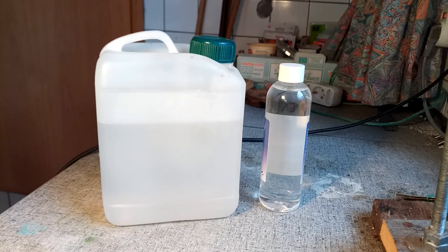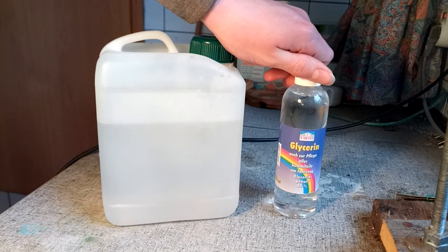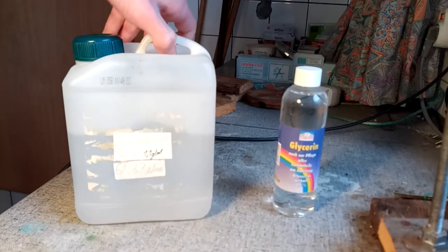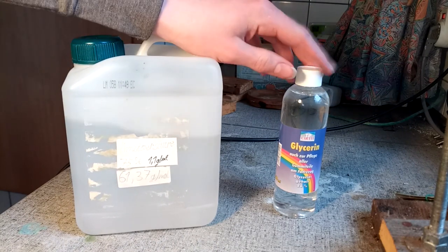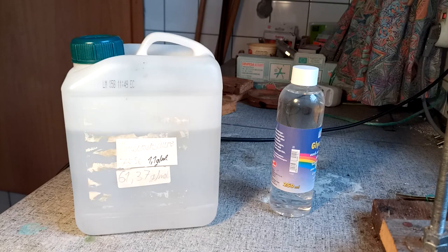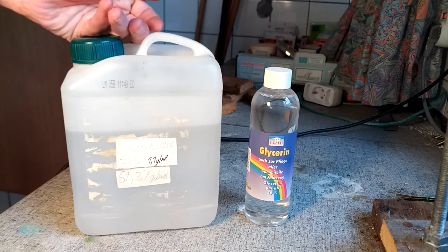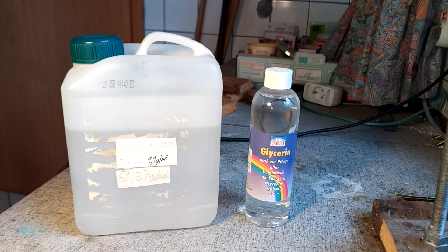Pretty much the only reagents we need for making allyl alcohol are glycerol — or glycerin, or 1,2,3-propanetriol if you really have to — and formic acid. Normally you'd use 100% glycerin and 85% formic acid. I don't have either of those; I have 86% glycerin and 75% formic acid. I can do something about the glycerin but the formic acid I'm not going to be able to purify, so I'm just going to wing it.